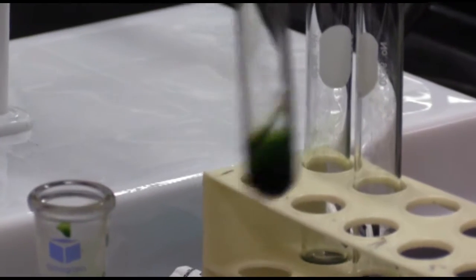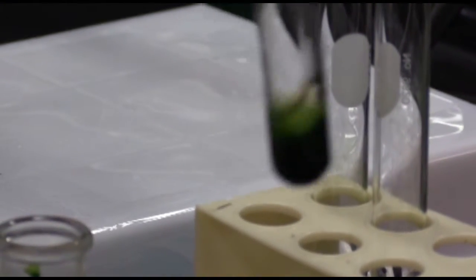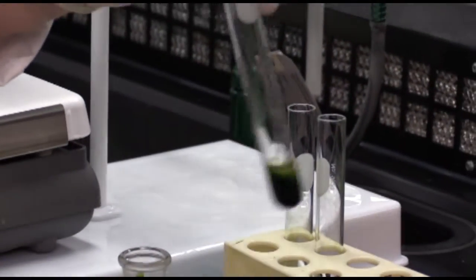Now we're going to mix. It's really important you take your time mixing in order to form two layers.